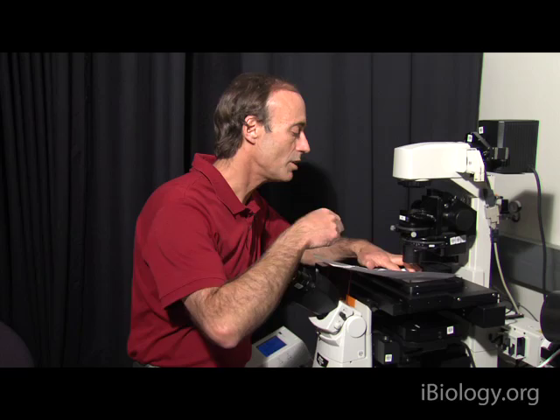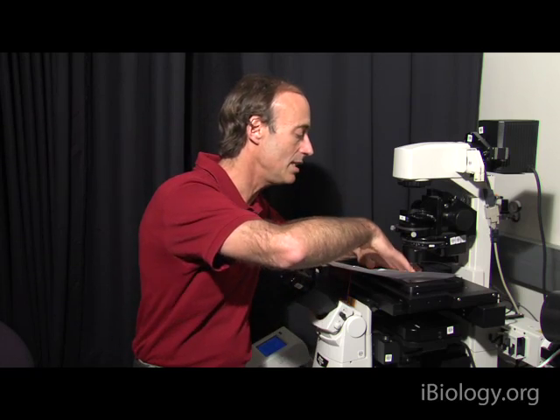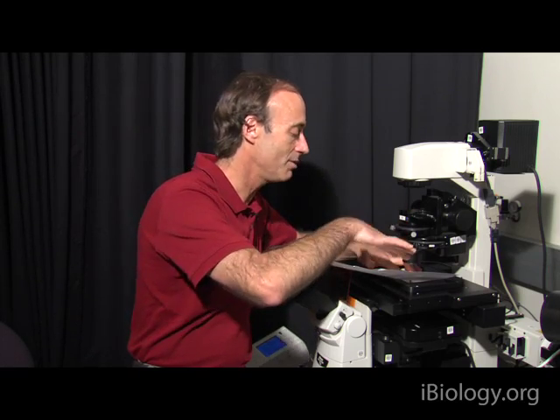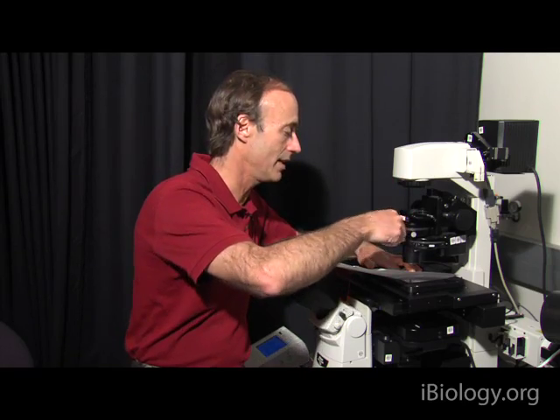This is called critical illumination, which as you can see gives very uneven illumination because we can see all the features of the light source.